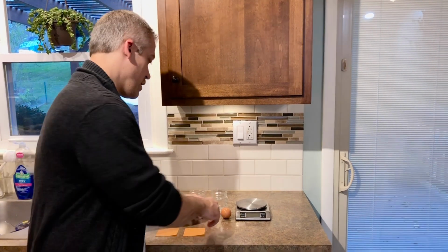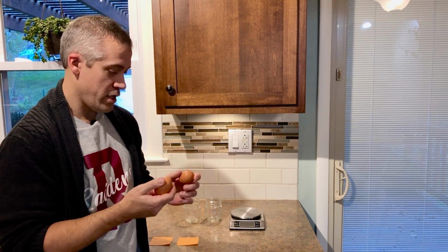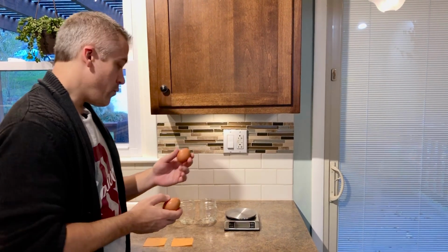So I have my 2 eggs, and like I said, these are cells. These are a single individual cell, and rarely do we get a chance to have individual cells that are this big. It makes them easy to study, which is nice. So we have 2 eggs. You'll see why as we move through this. I have labels here, egg 1, egg 2.